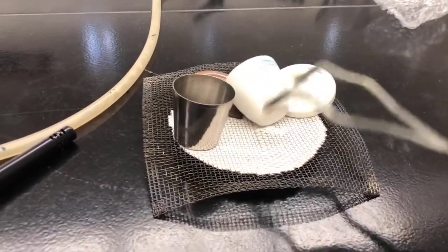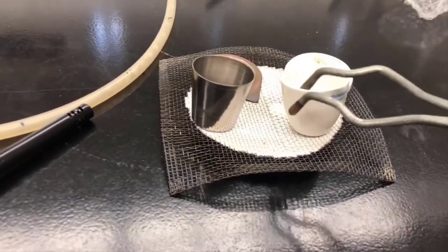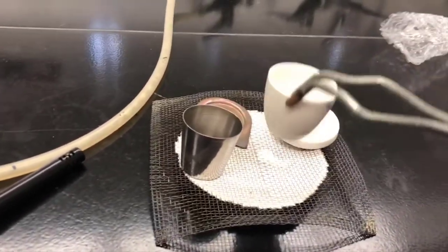The crucible itself, you should never try to grab it with the pinchers, unless you're just going to pick it up like this, which is okay for what we're doing.